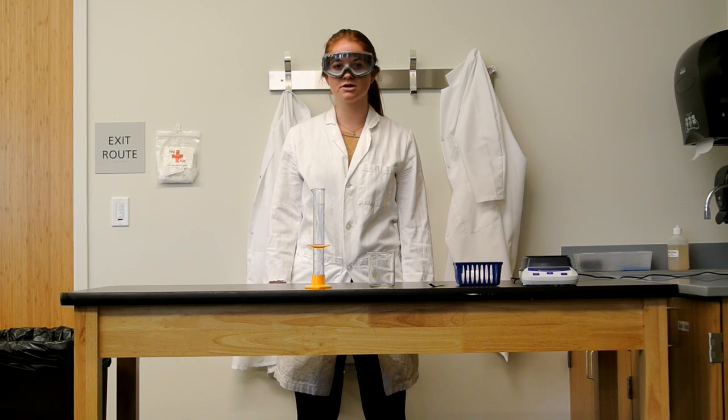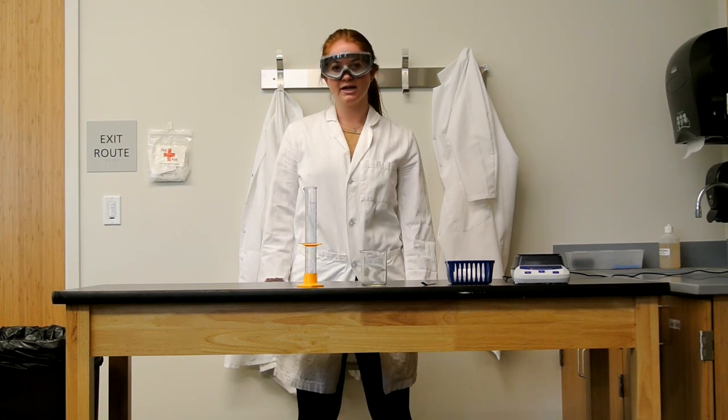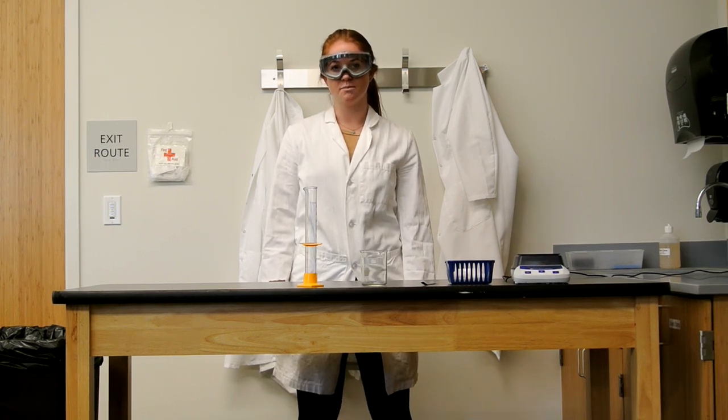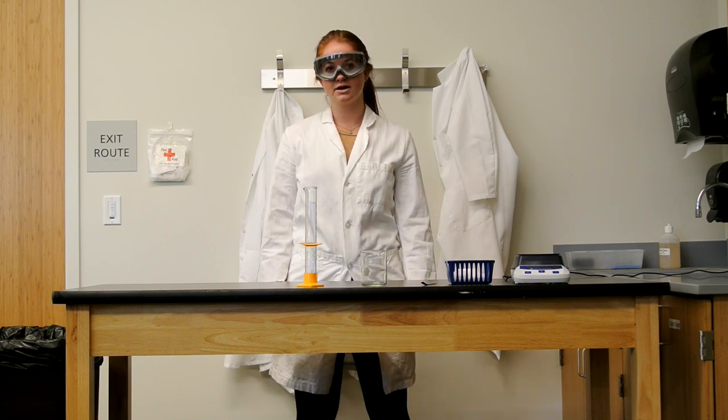Today I'm going to teach you how to properly measure and weigh materials. Before we begin, make sure you're wearing your personal protective equipment: goggles, a lab coat or apron, and some gloves.